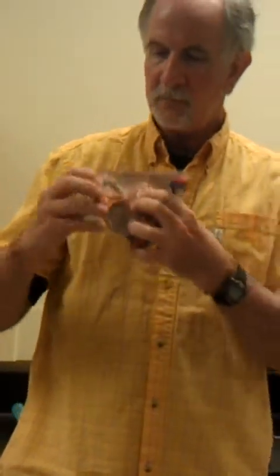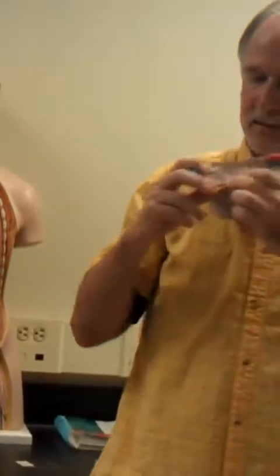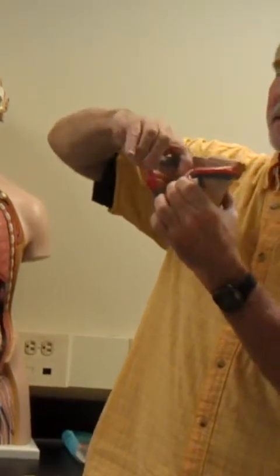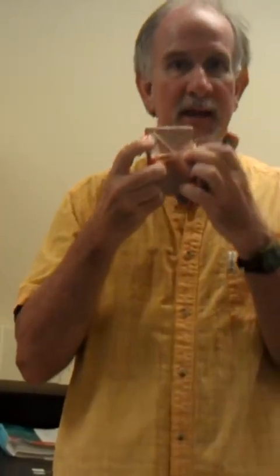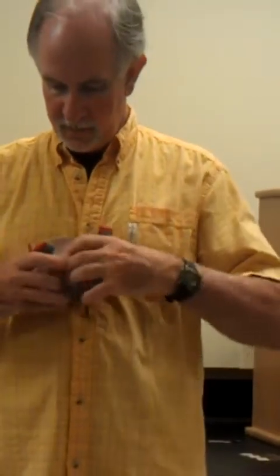All right, here's the ovary again. The ovary's in yellow, and then the red would be the fimbriated end of the oviduct. If you follow the fimbriated end, you can follow the oviduct all the way back to the uterus. Beneath the oviduct, it almost looks like there are two tubes there, but it's not two tubes. The round thing coming off the yellow-colored ovary is an ovarian ligament that attaches the ovary to the side of the uterus.